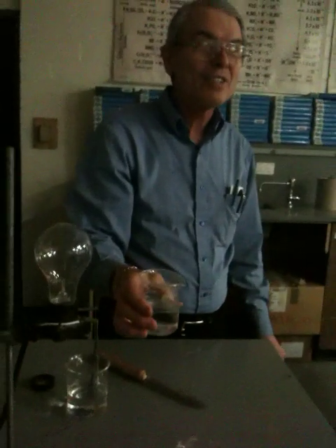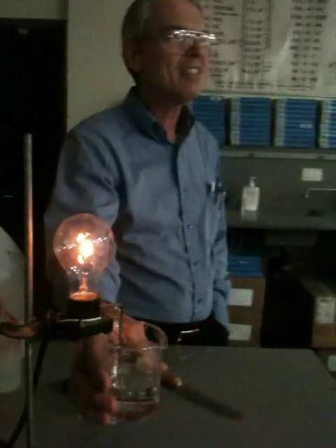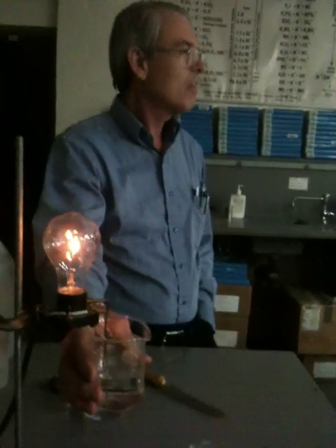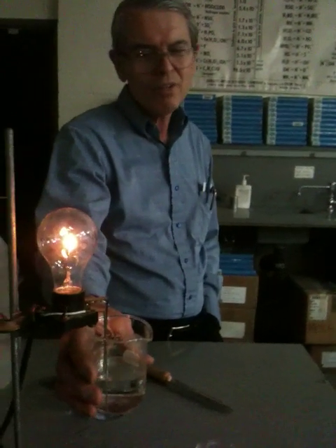Now I'm going to test for ions in the water. What's your prediction? It's going to work. Tap water — is it going to get really bright? No. Well, here we go. It does conduct. There are solutes in that water, and that's the stuff that you drink — it's not all so bad to get solutes. Solutes are not bad. They're bad if there are things that are unhealthy, but I don't think there's too much in here that's going to be unhealthy. I would be more concerned about the bacteria.